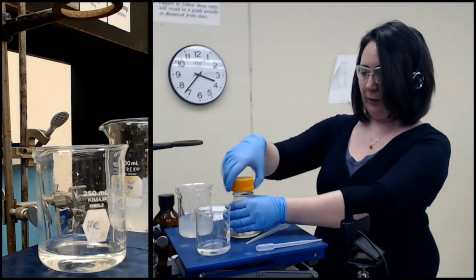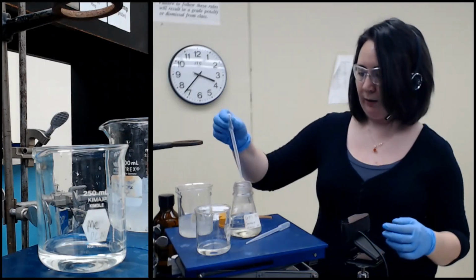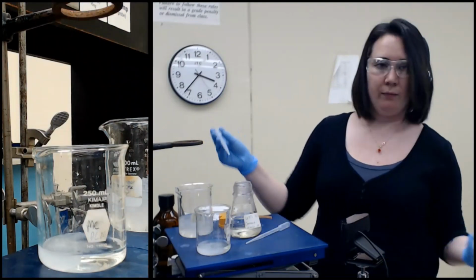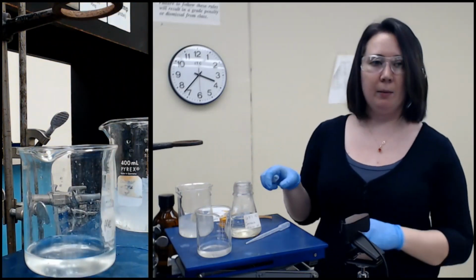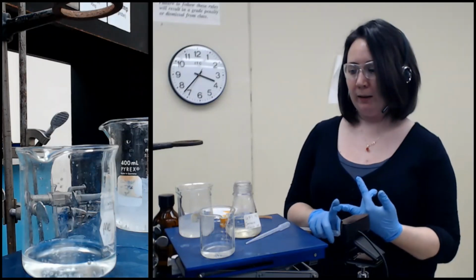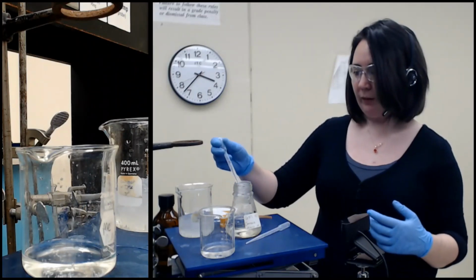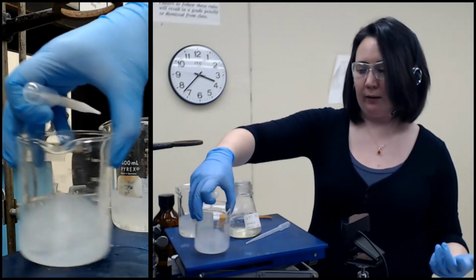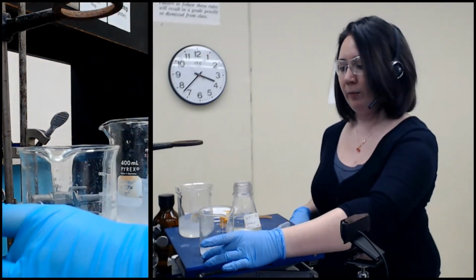So 6 molar HCl, it's not fully concentrated, it's pretty concentrated though. Stock HCl is about 12 molar, so I still want to be careful, it's still pretty corrosive. I'm just going to take a pipette and add that amount. You can see it bubbling. That is the reaction of HCl and sodium bicarbonate, as well as our carboxylate salt. So we need to make sure we add to a pH of 2, because not only are we trying to neutralize our compound, we need to neutralize all of the sodium bicarbonate that's in there too.